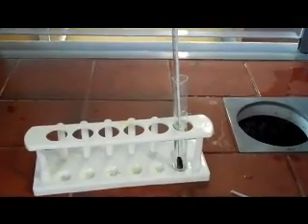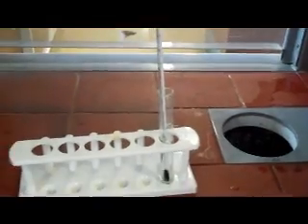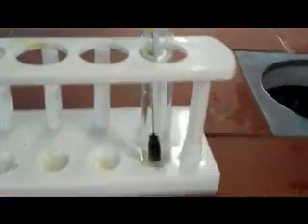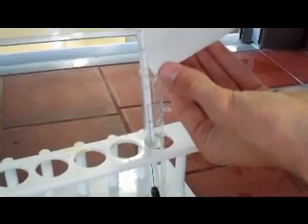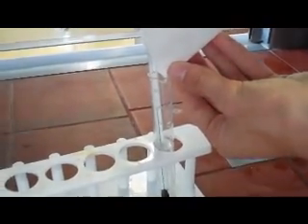This is the last of the 6 mini experiments. We've got 10 mls of water at 20 degrees and we've got 1.5 grams of sodium thiosulfate. So 1.5 grams sodium thiosulfate, and we're mixing the two together to see whether the temperature rises for an exothermic reaction or the temperature falls for an endothermic reaction.